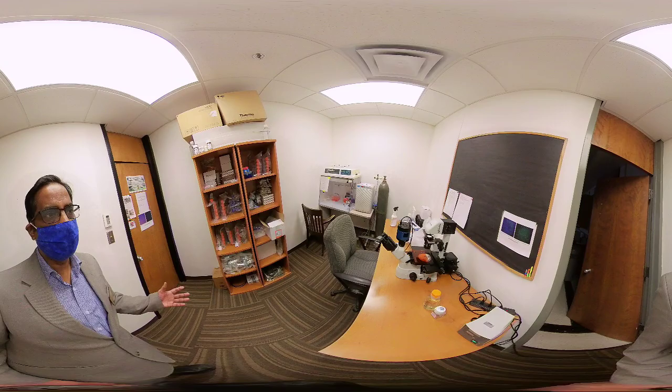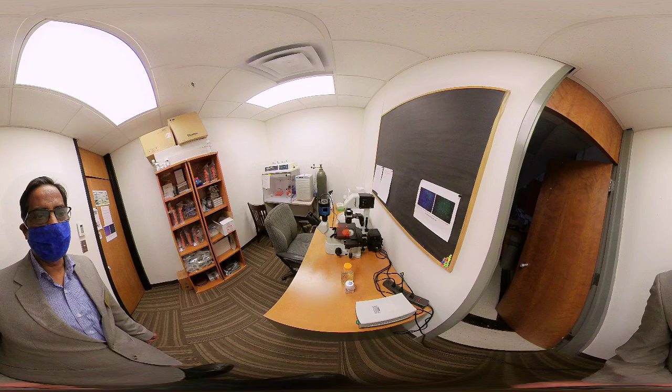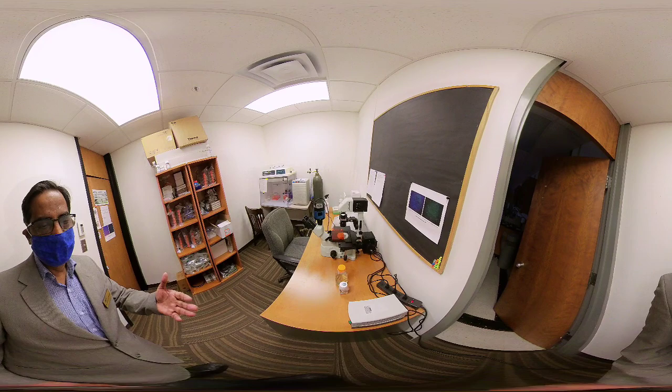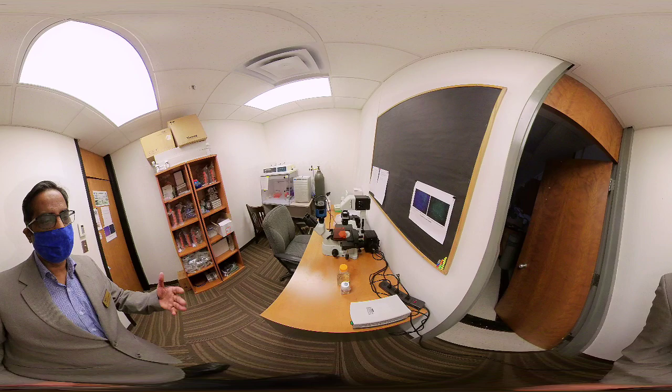One of the facilities I'm going to introduce here is our inverted fluorescence microscope. We received an equipment grant from NSF EPSCoR for this. We use it to observe cells that have been treated with different things, so we can see the cells and look at them closely.